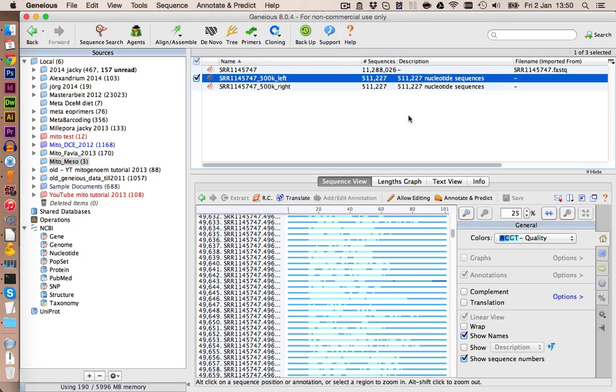Hello everyone! In the last video we imported our next generation sequence data, and in this video I will show you how we can find mitochondrial reads in this sequence data.